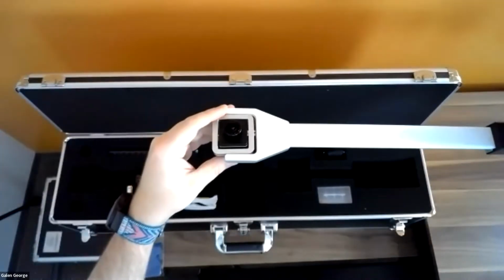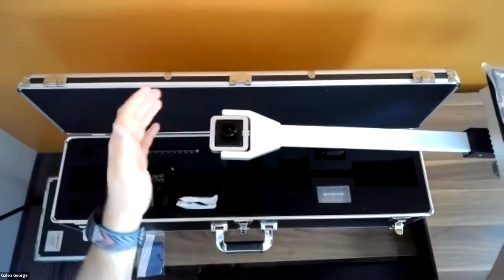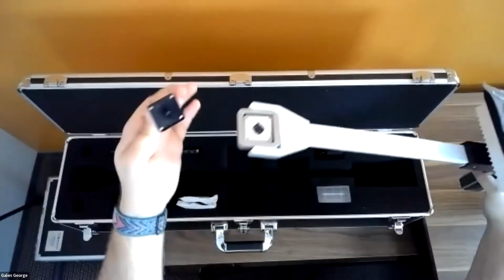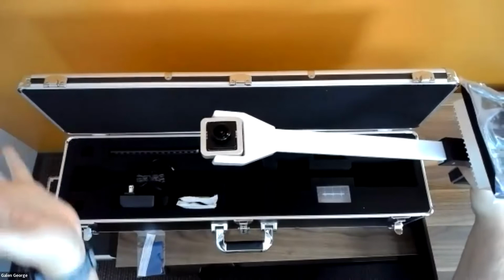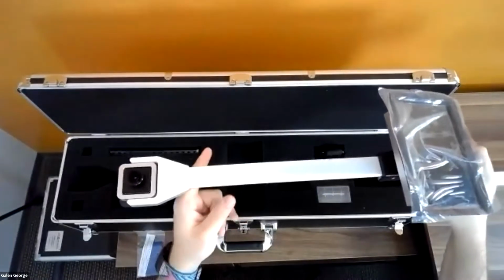And as I mentioned about the filters, the nice thing is that this is very easily compatible with any kind of physical camera filter, where you can just magnetically pop this off, and then you can put your filter right in there, and then this just latches right back on. It's magnetic, so it's very convenient to put your filters in and out.